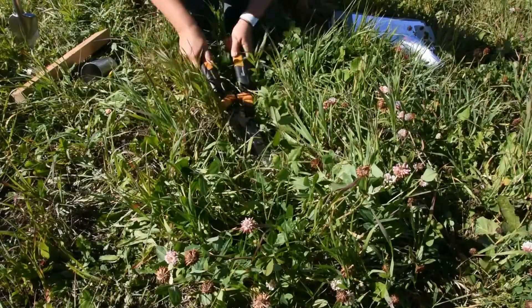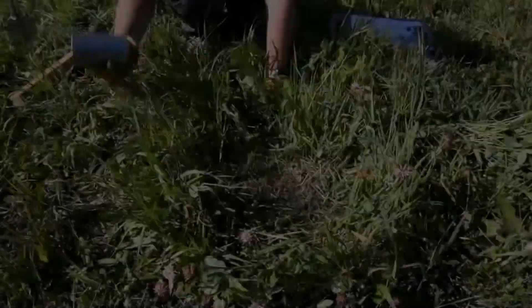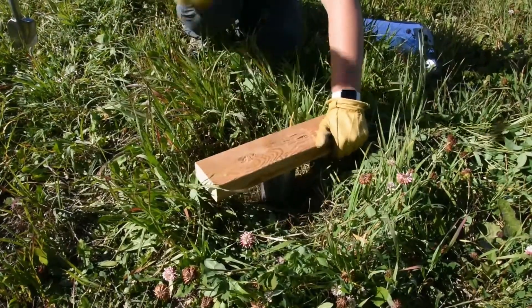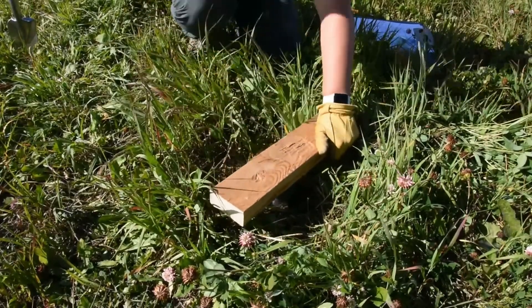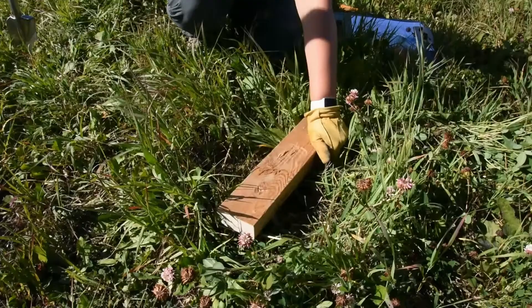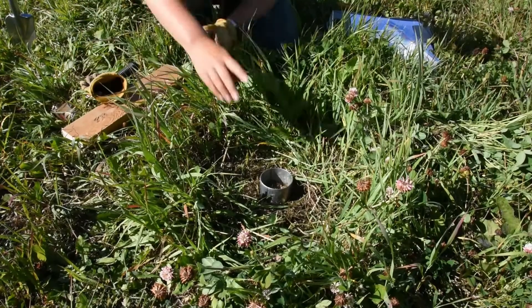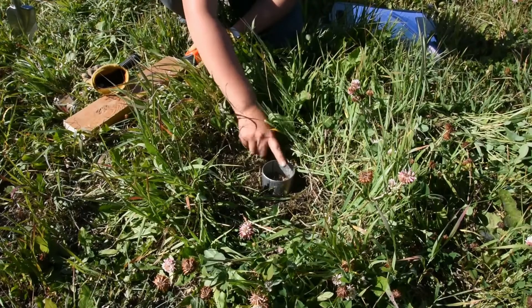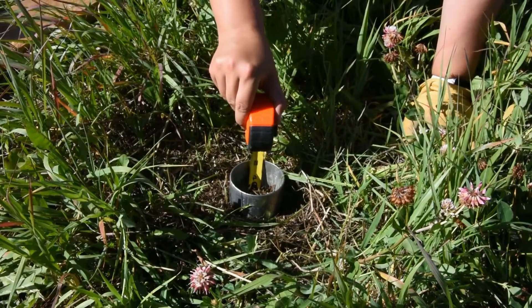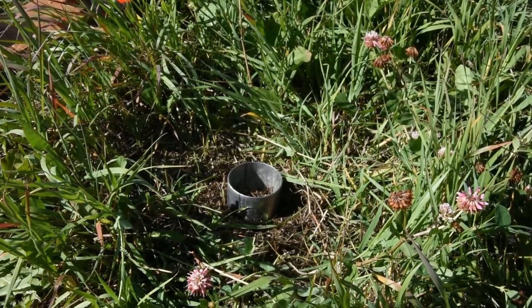First, clear off your area. Put your ring down and, watching your fingers, hammer it in. Once you have it in, you want to take a measurement to see how much head space is left in the cylinder — the goal is two inches. Take that measurement at different angles in your ring and record them in your book.